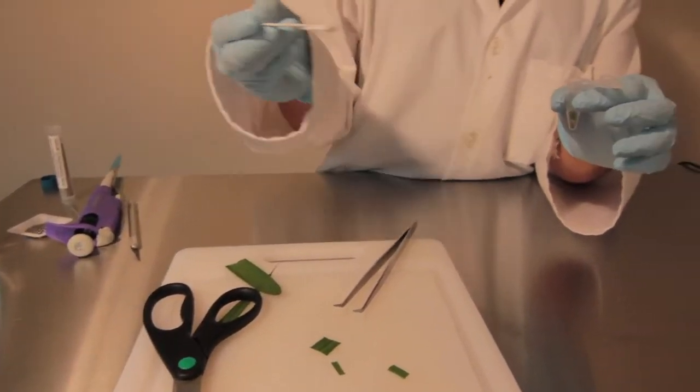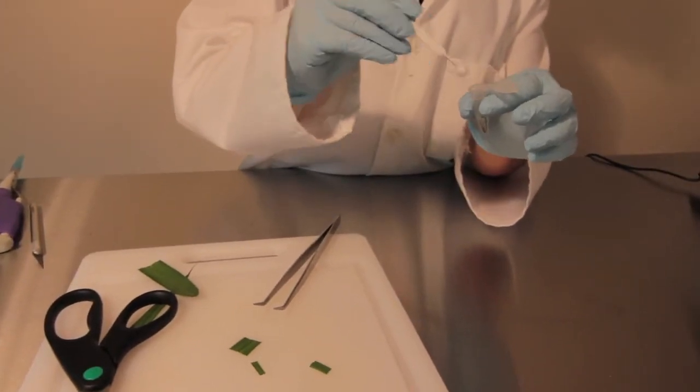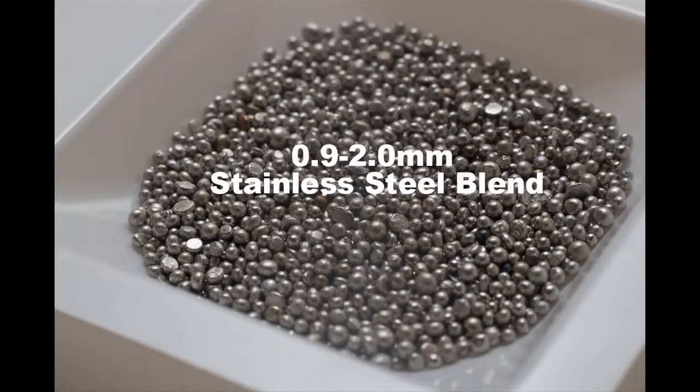Next, add your beads. For plant samples, I recommend using stainless steel beads, such as the 0.9 to 2.0 millimeter blend.